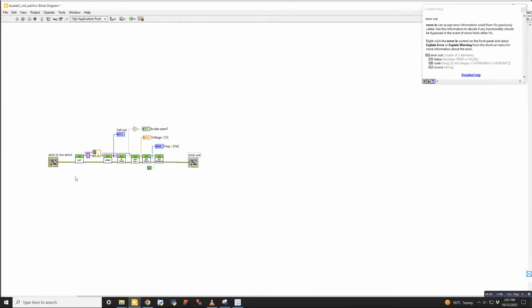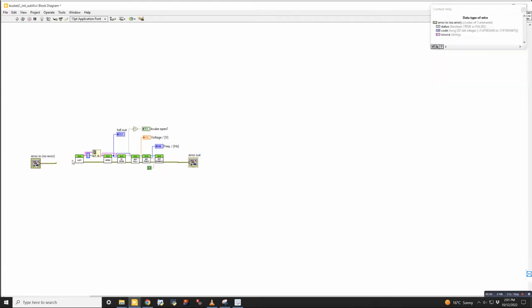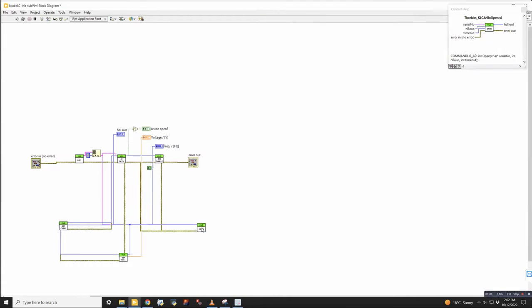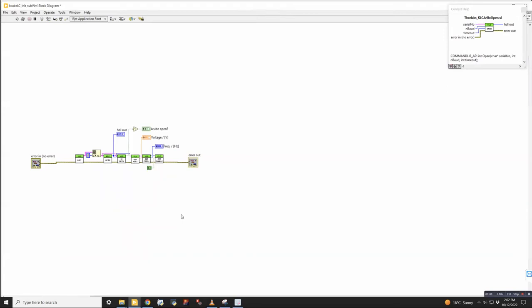The flow of information can be controlled with error wires. So these error wires are typically connected to the bottom left and right as the input and output. And if you string the order of things you want to execute along an error wire, then that's the easiest way to control the order of execution in LabVIEW, because these things can be organized all over the place. I can do this and that and that. And, you know, it looks really terrible, but it's still going to work because the error wires are going in the correct order of execution. So I'm going to go ahead and undo that because it was just absolutely rude to do.